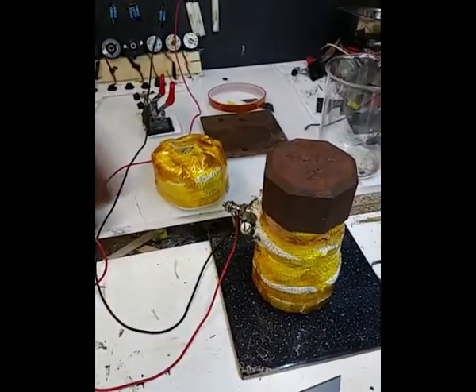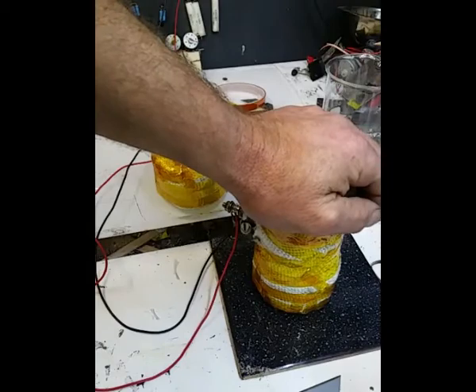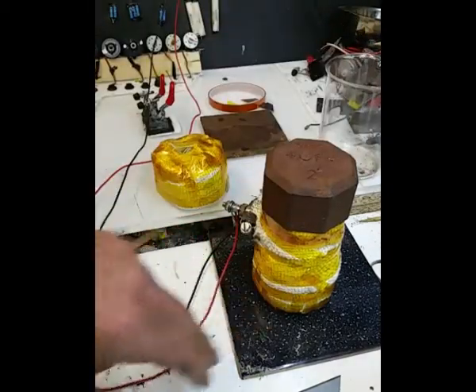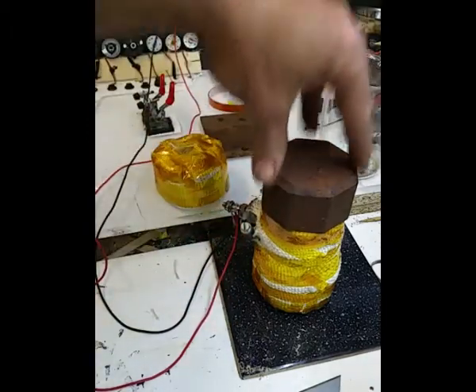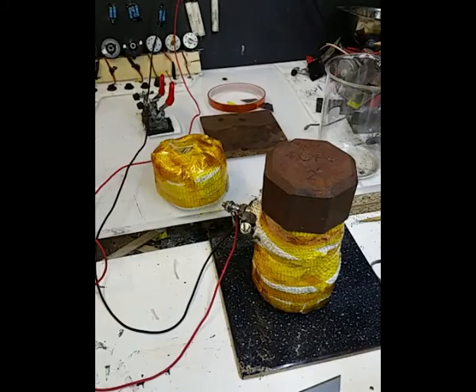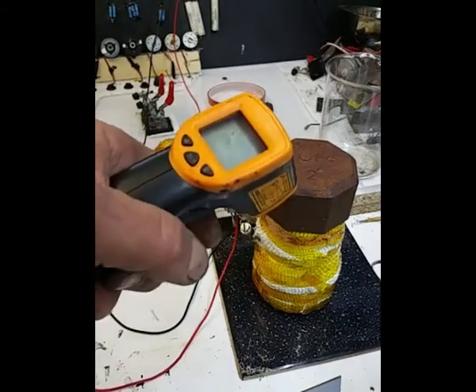That's been on for about 30 seconds and yeah, the temperature's coming up. Now I didn't preheat this time obviously because I've got this stuff on there. Yeah, I could have turned it upside down and heated it from there, but you know, I'm just trialing it this time from cold.